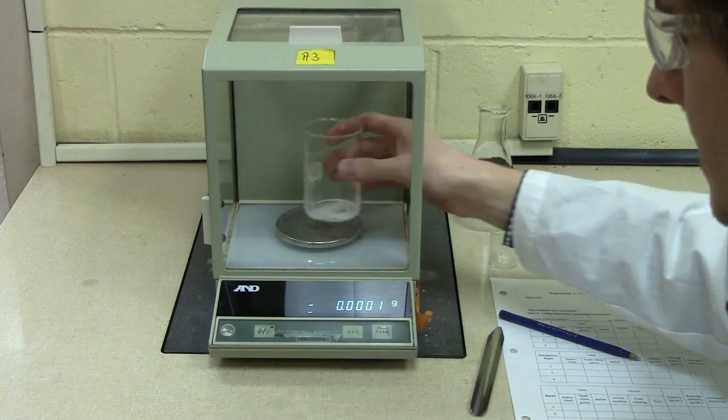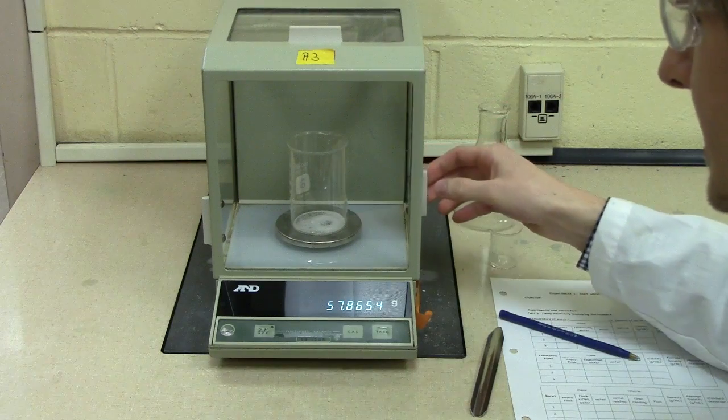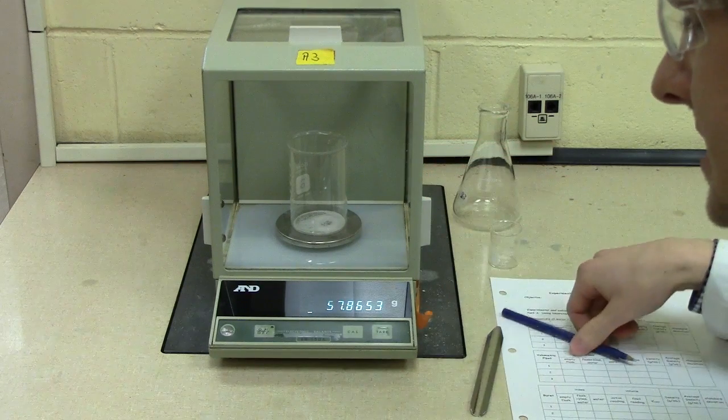You then want to take measurement of the mass on the analytical balance to determine what the mass is of the full beaker.